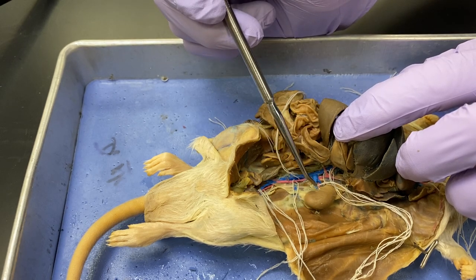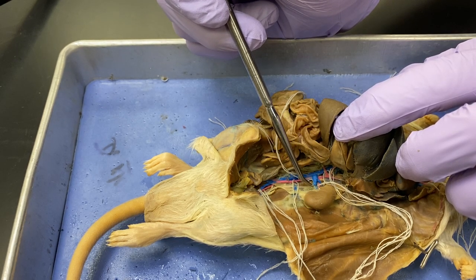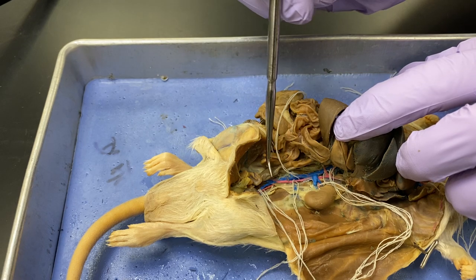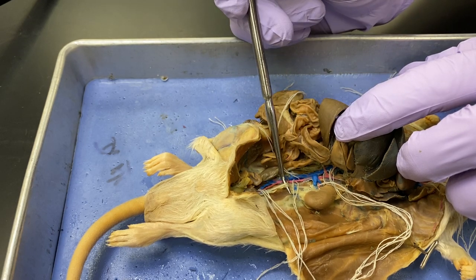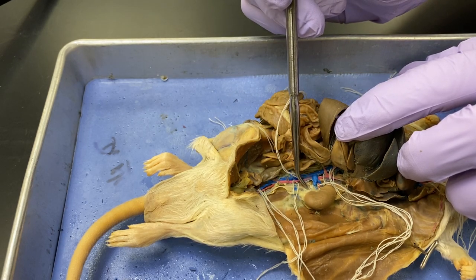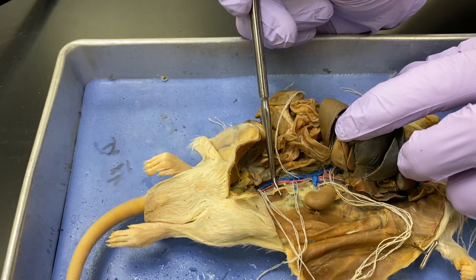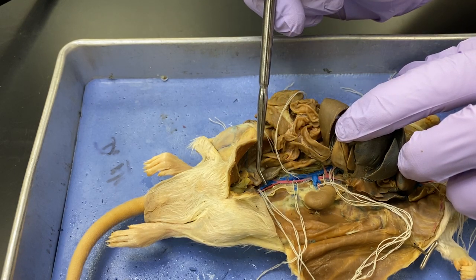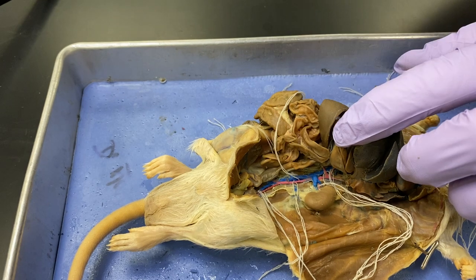Left kidney. You can't see where the ureter leaves necessarily, but you can pick it up right here. You can see it kind of in the membrane there — this is the ureter, and it drains down here, disappearing behind this.